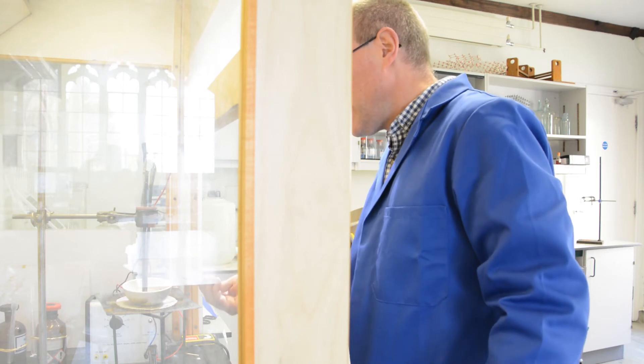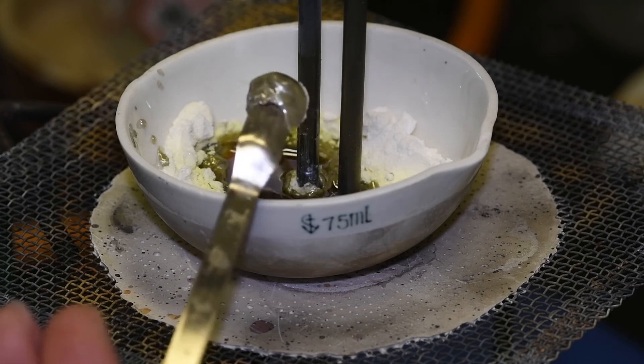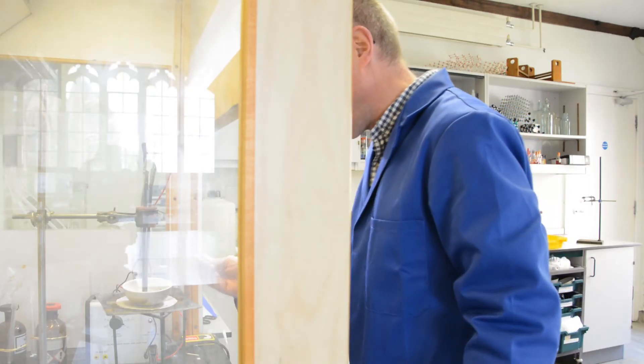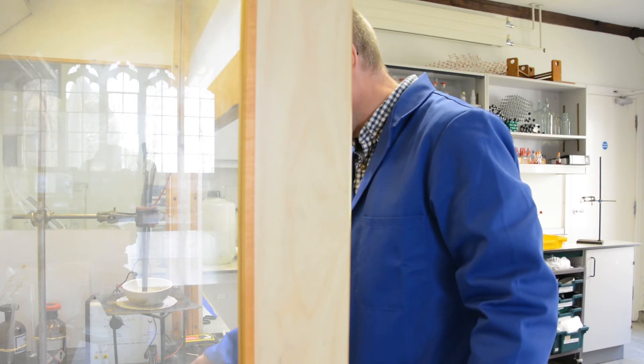So you can see bits of lead building up on the spatula, so we've definitely produced lead in there. So it is conducting, it is electrolyzing.